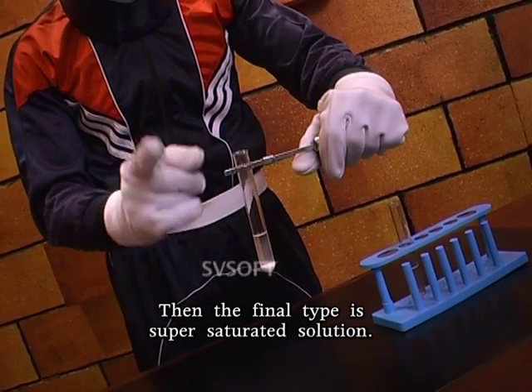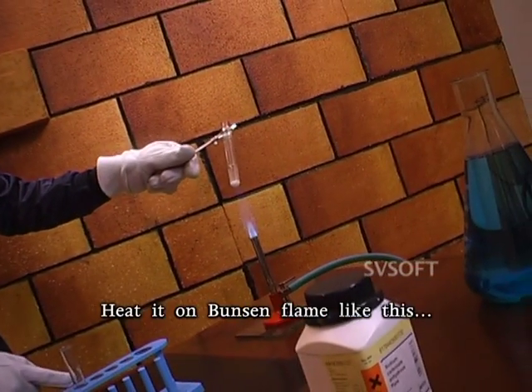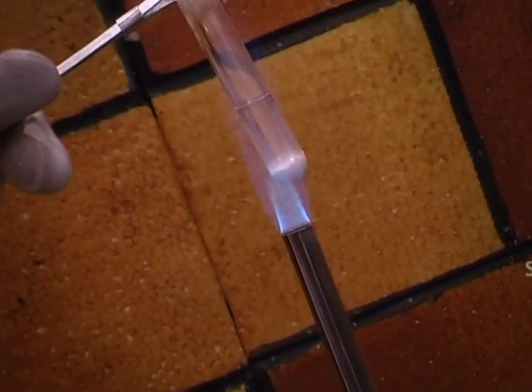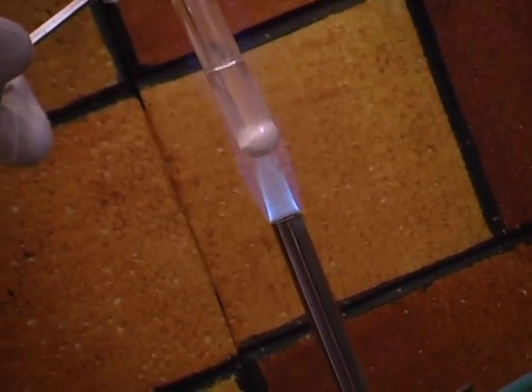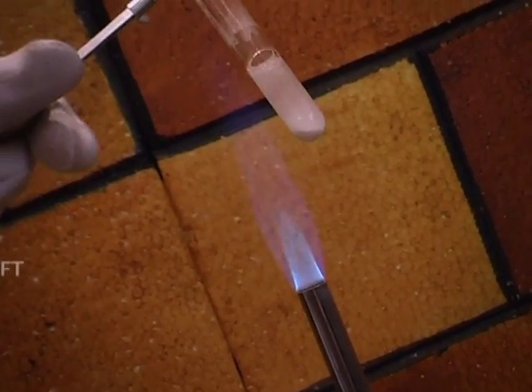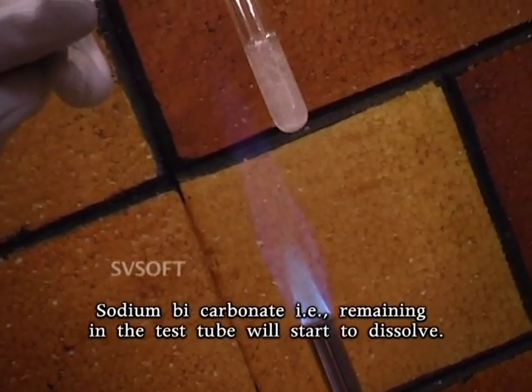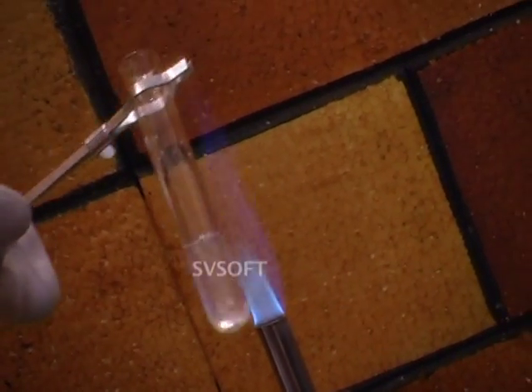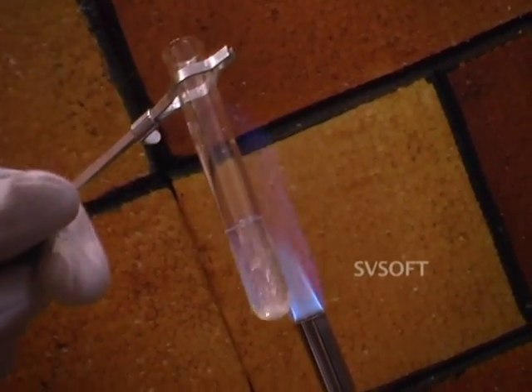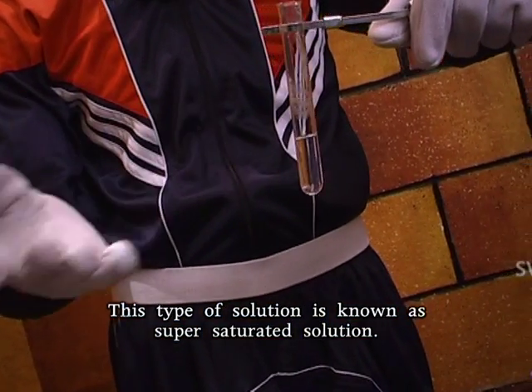Then the final type is supersaturated solution. Now take the saturated solution, heat it on Bunsen flame like this. Friends, now see the change. Sodium bicarbonate that is remaining in the test tube will start to dissolve. This type of solution is known as supersaturated solution.